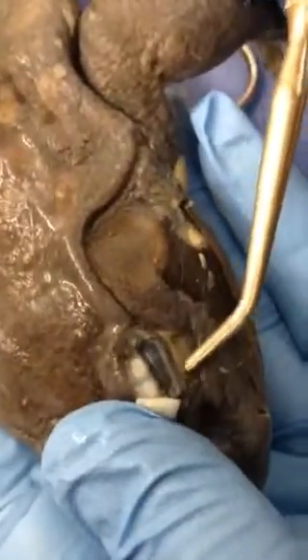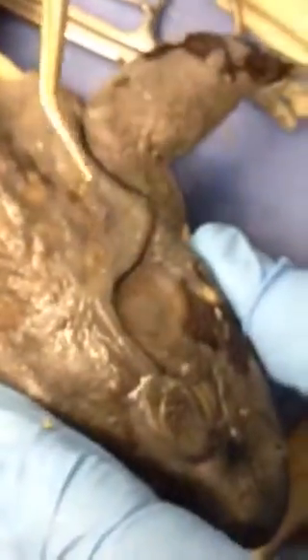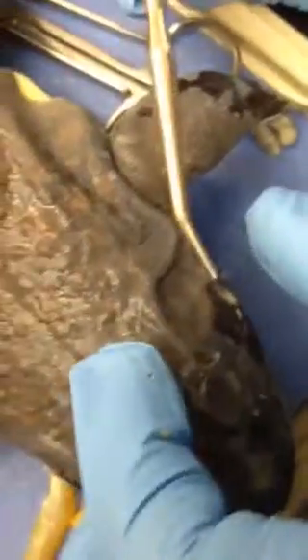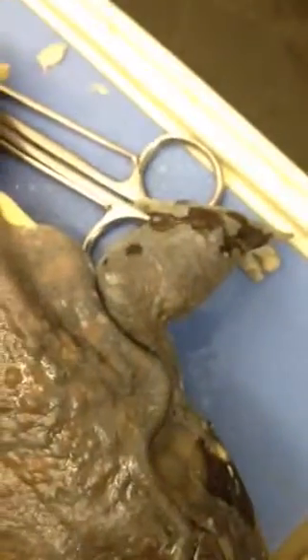The nictitating membrane — I have cut away the top eyelid here, but you can see this membrane at the bottom right here. This is the nictitating membrane; I'm trying to get it to go up but it's not cooperating. The tympanum is right here. Nobody has a male out, but the testes looks like a small little kidney — actually more like two little lima beans, or kidney beans.